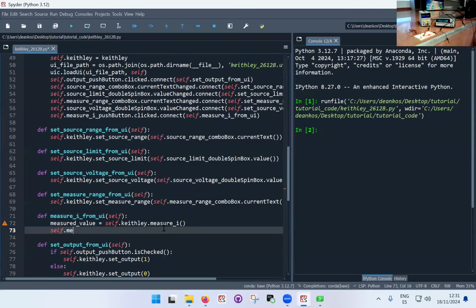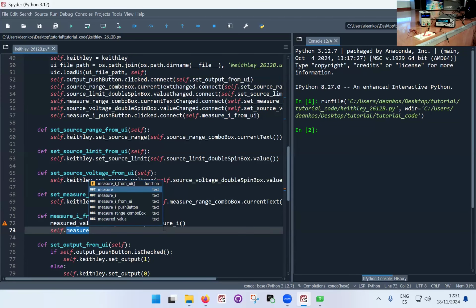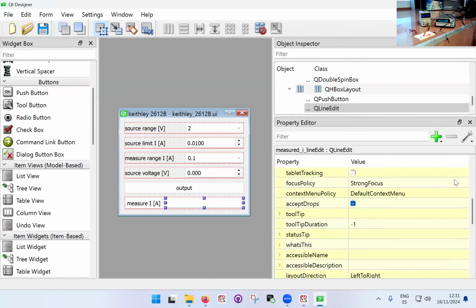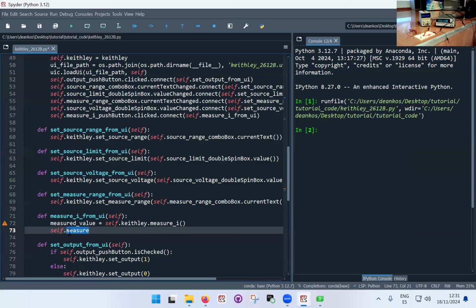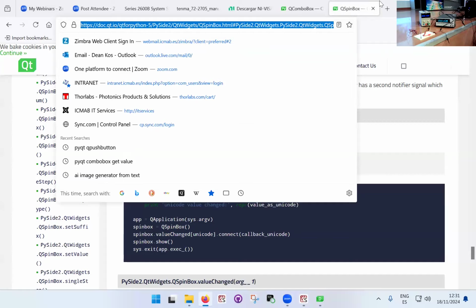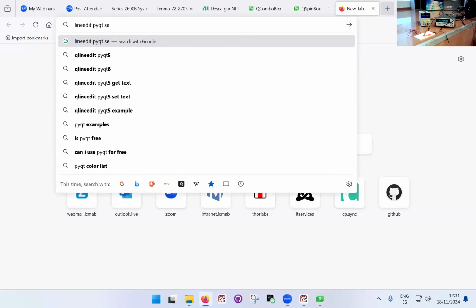So self dot measure I. What is this spin box called? Line edit, measured I line edit. Okay. Self dot measure I line edit. I'm just going to type it. Self dot measure I dot line edit dot. And here I need to again look up the documentation and see how do I put a piece of text in the text box. So I go back to the documentation and I look it up. Line edit, PyQt set text.